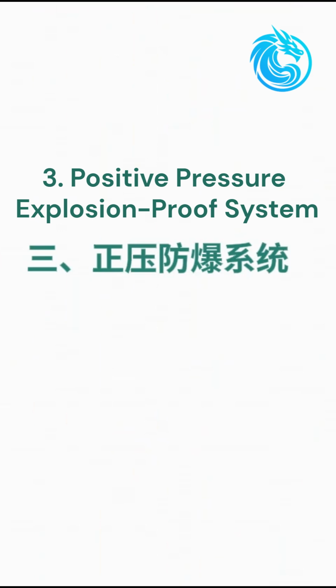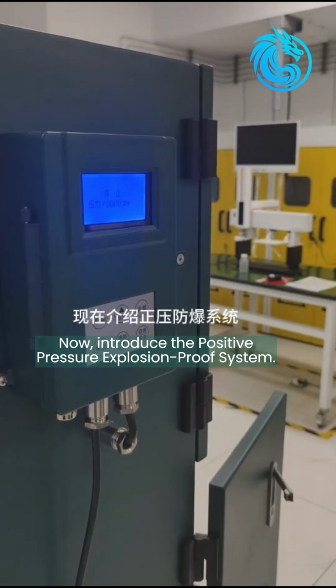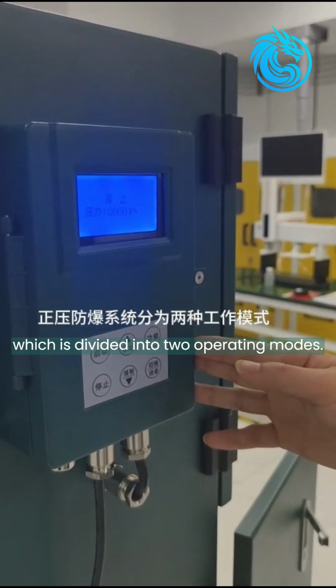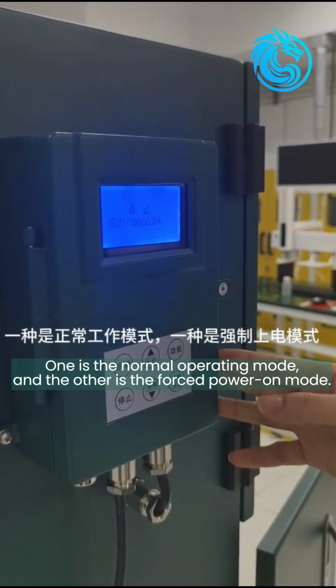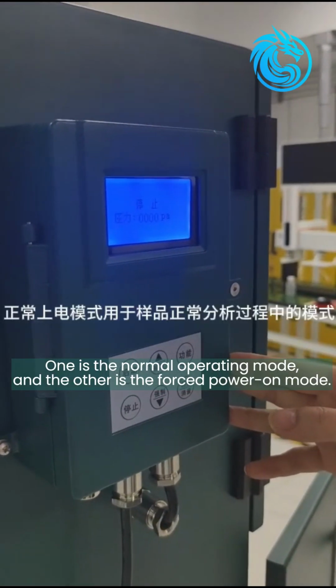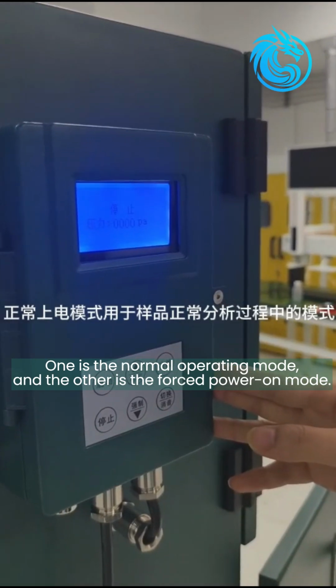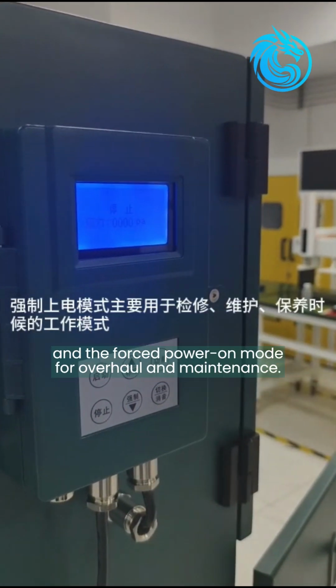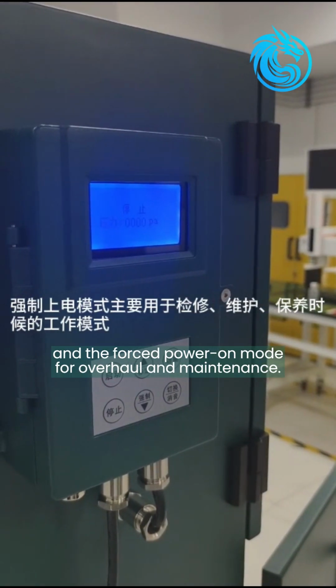Positive pressure explosion-proof system. Now, let's introduce the positive pressure explosion-proof system, which is divided into two operating modes. One is the normal operating mode, and the other is the force power-on mode. The normal operating mode is used for the normal analysis of samples, and the force power-on mode for overhaul and maintenance.